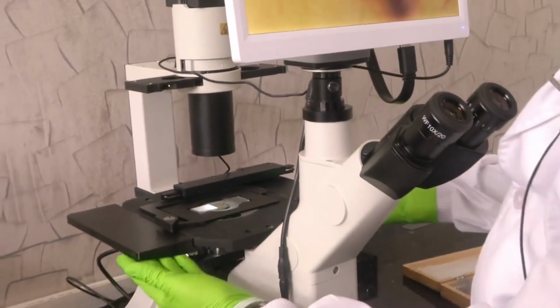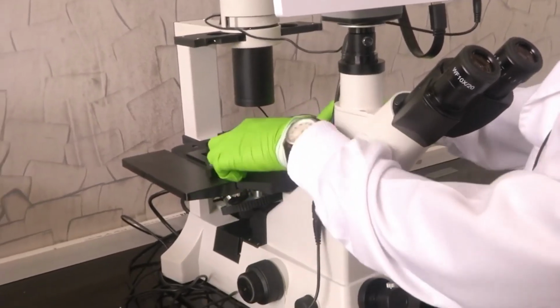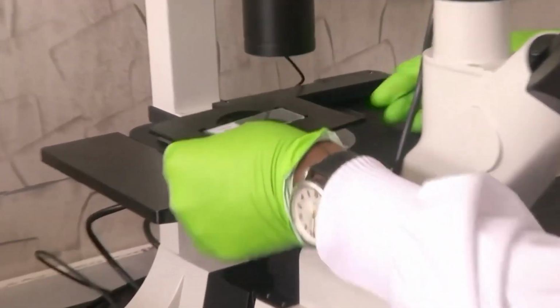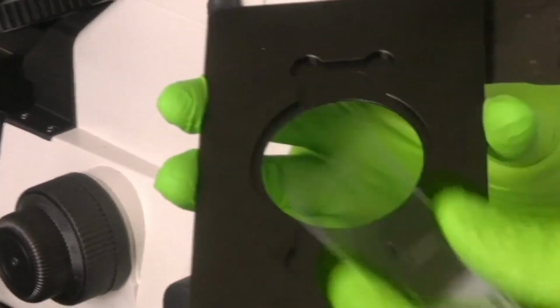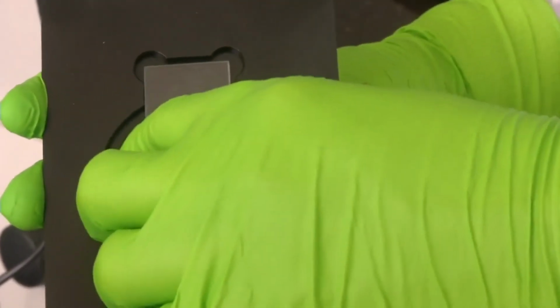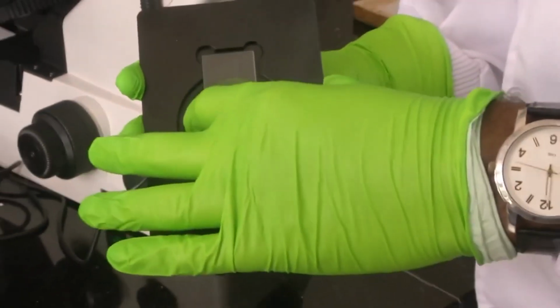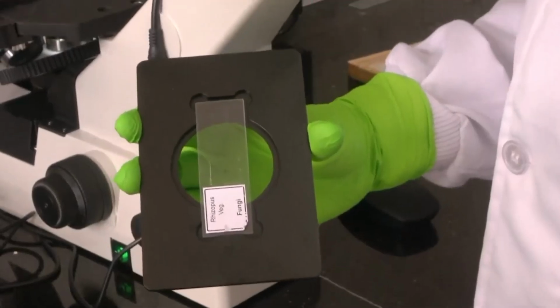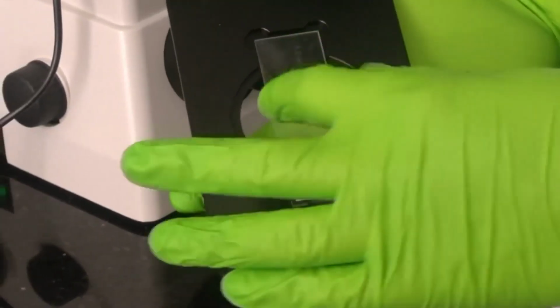Then we have the sample stage, which is also part of any microscope. We can keep our sample on this, and the sample stage also comes with stage holders that are specifically made for different types of sample holders. So there is a stage holder for putting this type of glass slides. You can put the stage holder like this, then the slide will stay there without slipping. So this is the sample holder which we discussed right now.